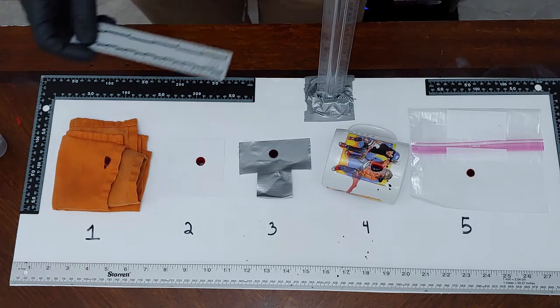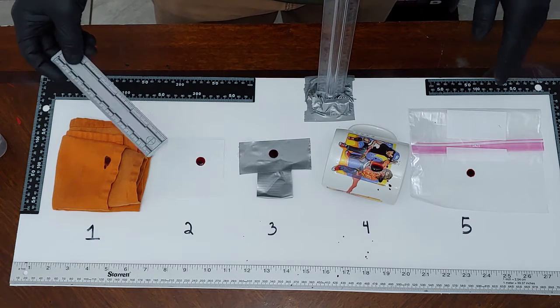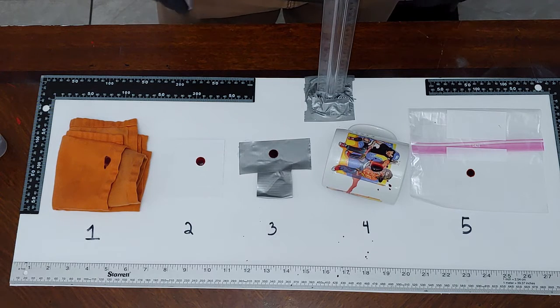So even though they fell from the same height, you saw them drop, same exact mechanism, this one is slightly larger than this blood stain. So just be really careful trying to interpret results on different materials. This is an example of blood drip stains on multiple surfaces under the influence of gravity only.